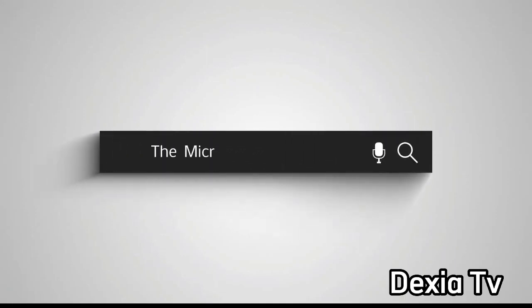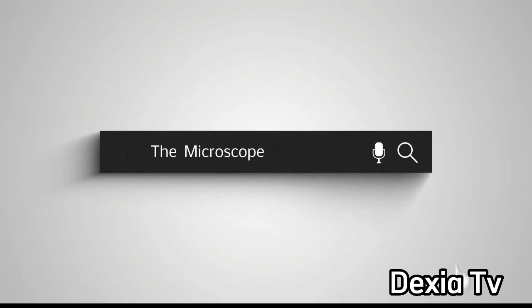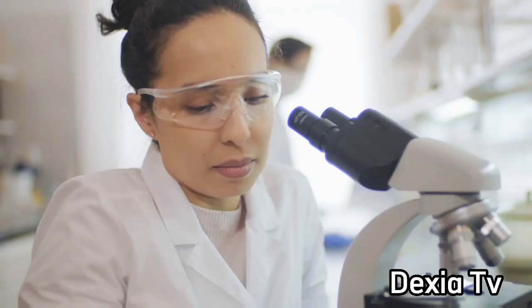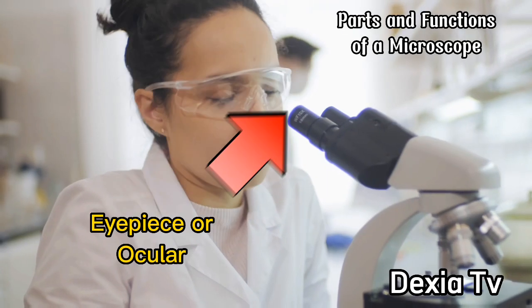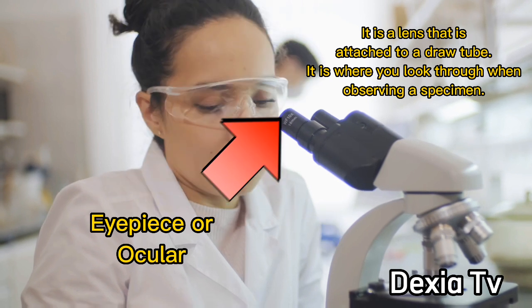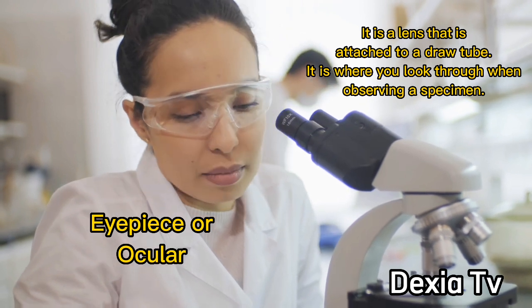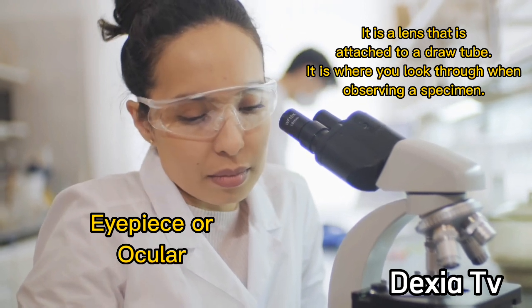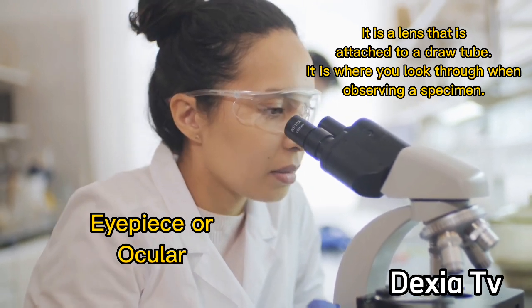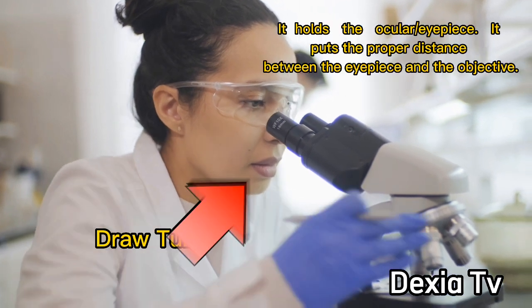The microscope. Parts and functions of a microscope. Eyepiece or ocular: It is a lens that is attached to the draw tube. It is where you look through when observing a specimen.